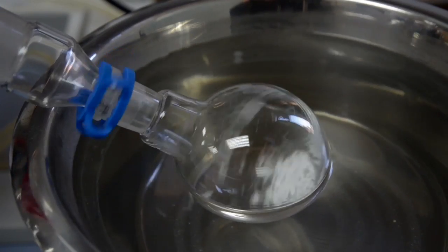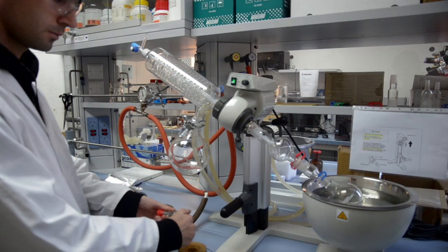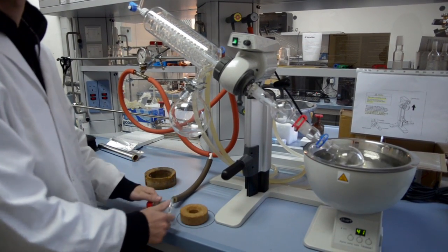Once all solvent appears to be removed, close the vacuum tap fully and leave drying for around 15 minutes.